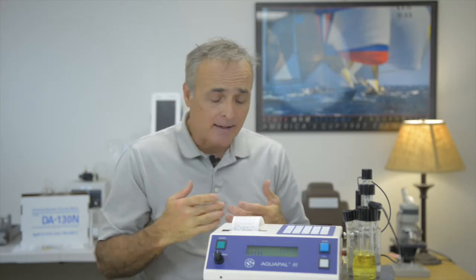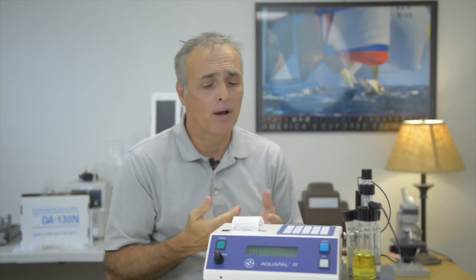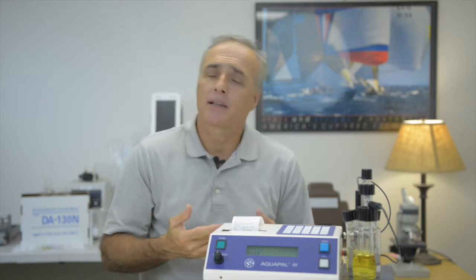I wanted to go into a little bit further discussion as to why we would want to use specific gravity, or why some organizations use specific gravity. Weight is the preferred method for getting really accurate results. We weigh our sample on a 4-place balance, we enter the beginning weight and the ending weight, and that's how a lot of people do it. However, if you're in an environment where you don't have a place for an analytical balance, specific gravity is a great alternative. So what is specific gravity?